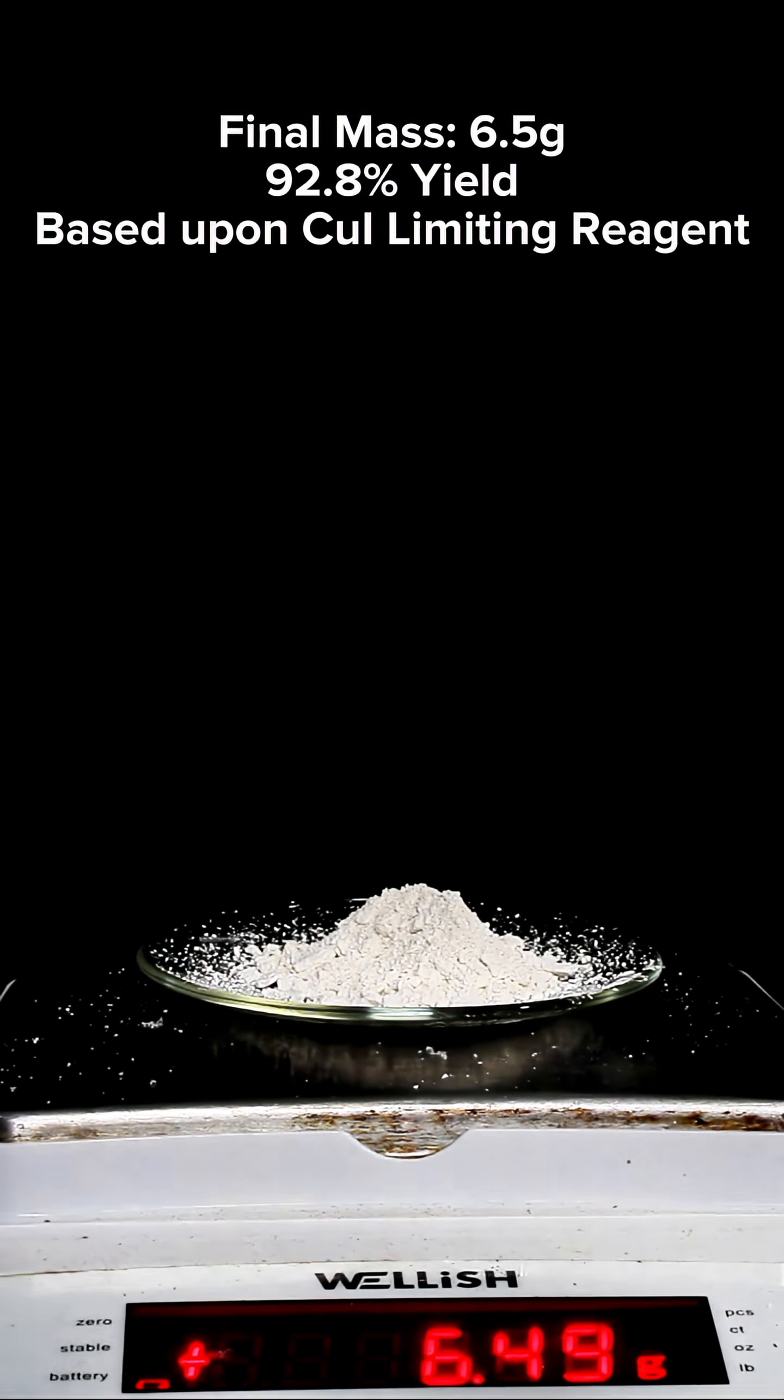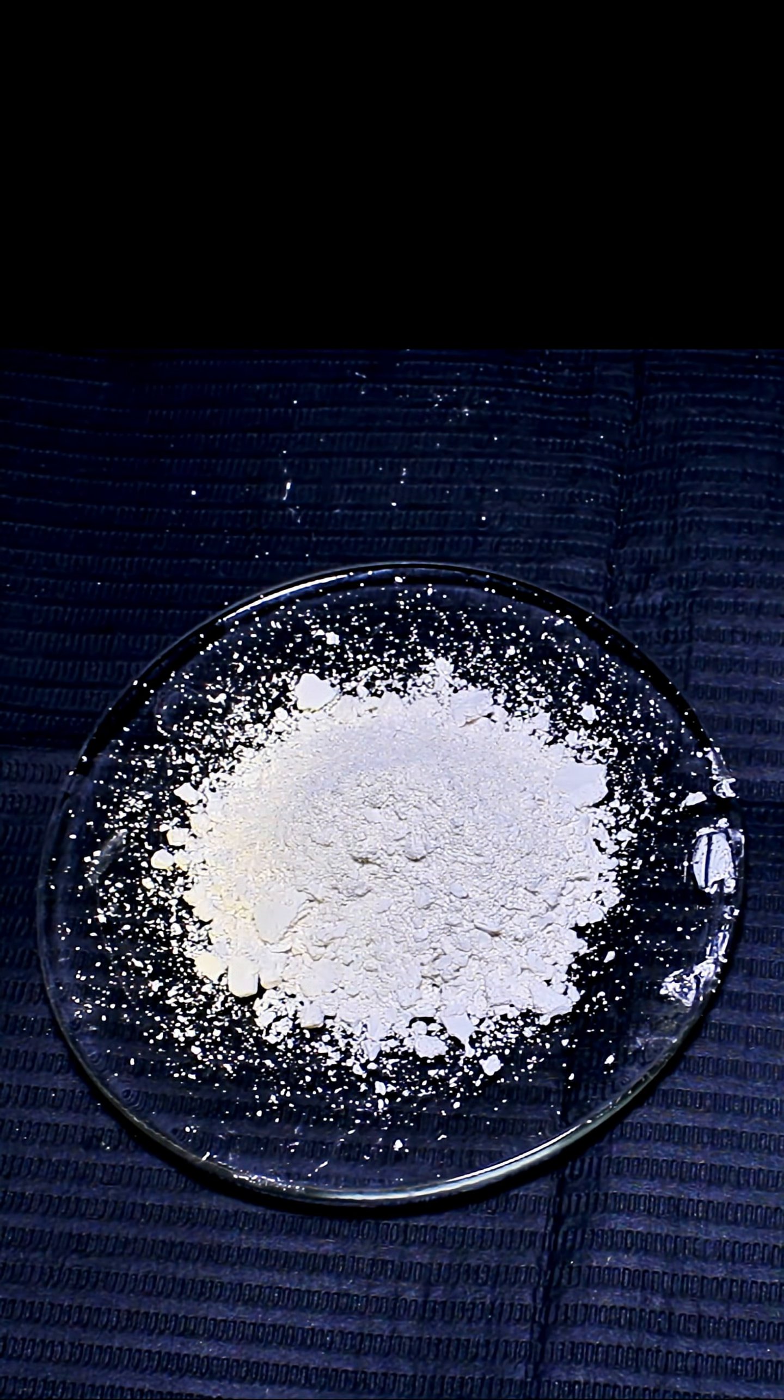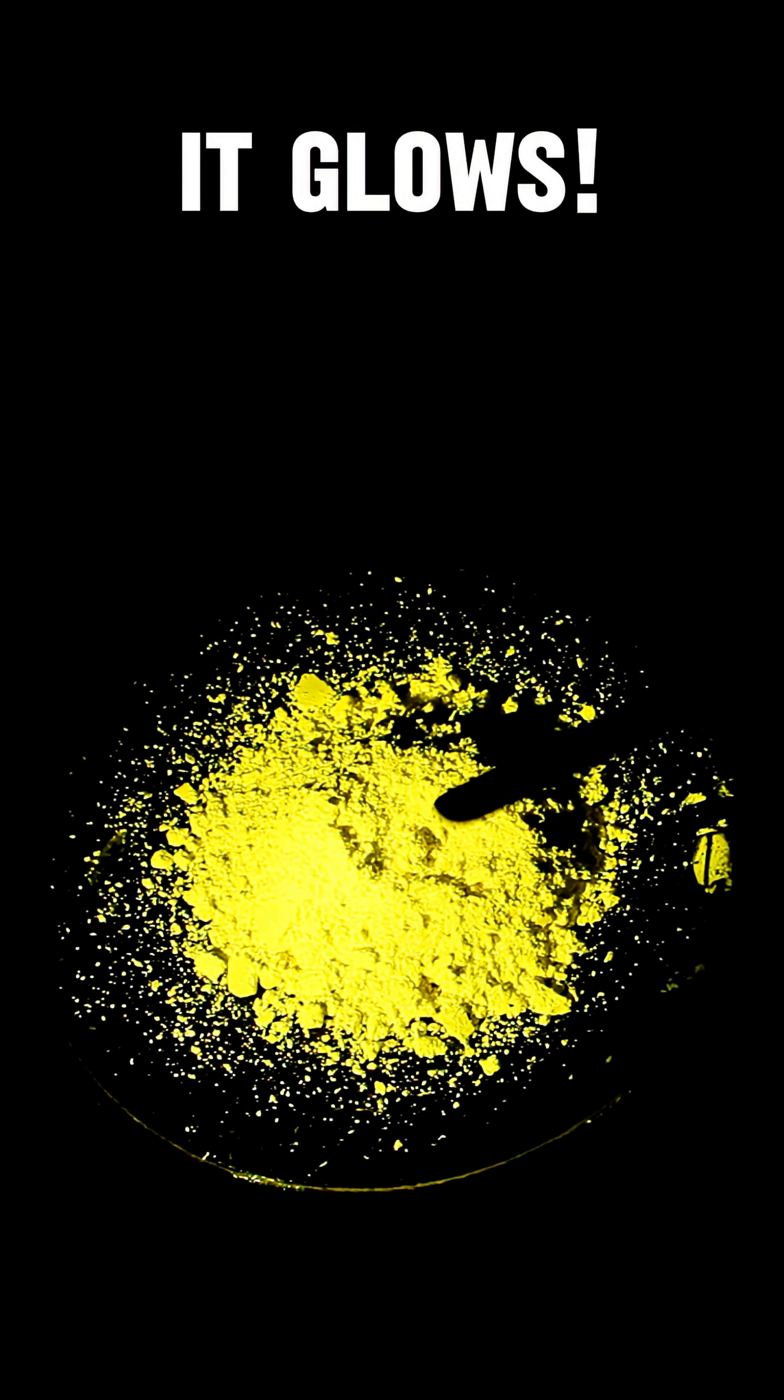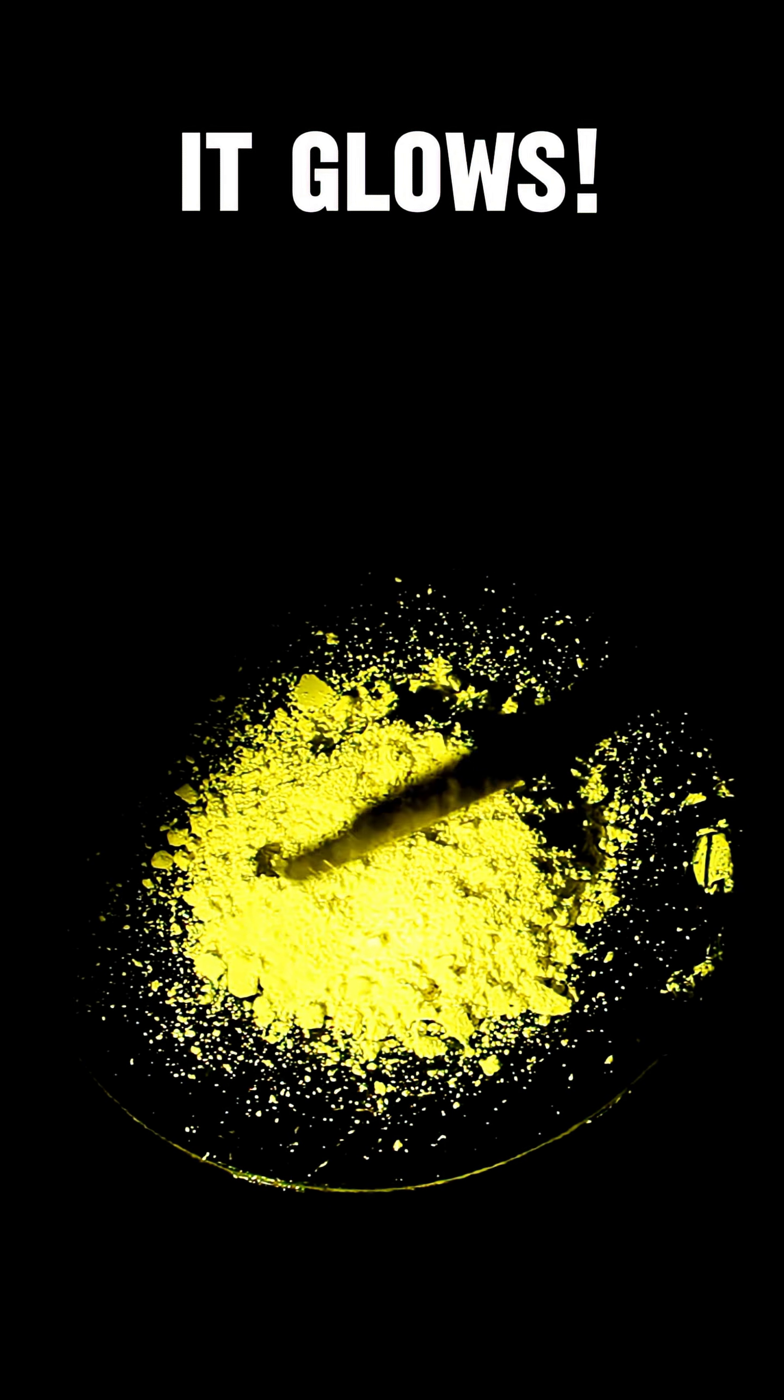Now for the fun part. If I take this chemical and place it under UV light, it fluoresces a very bright yellow. This color is even more intense when I turn the lights off, and it's so bright you can't even see the UV light.